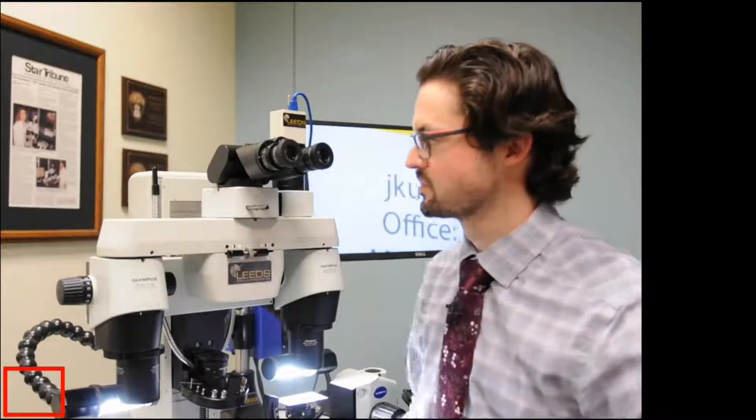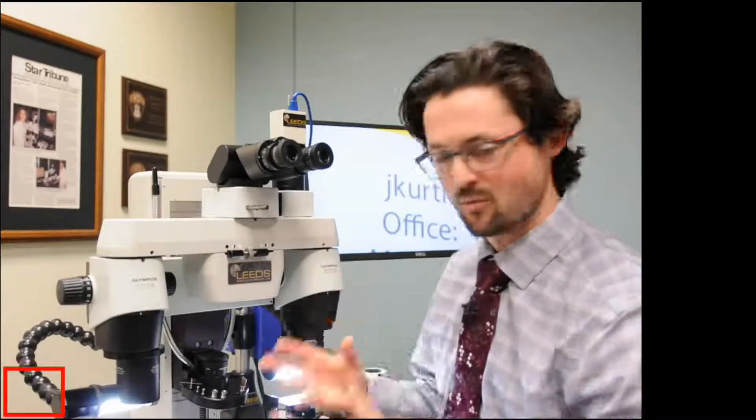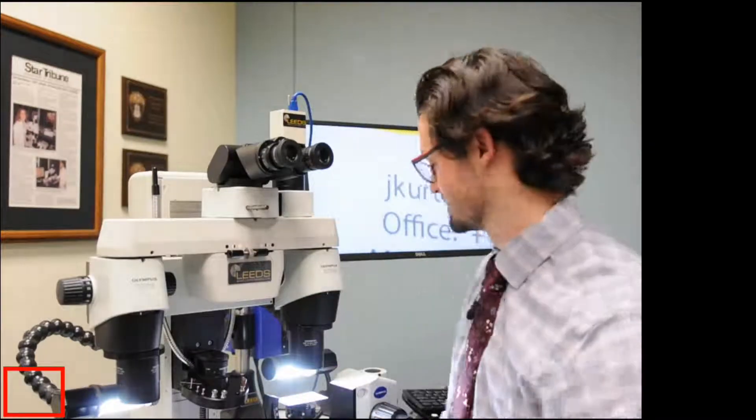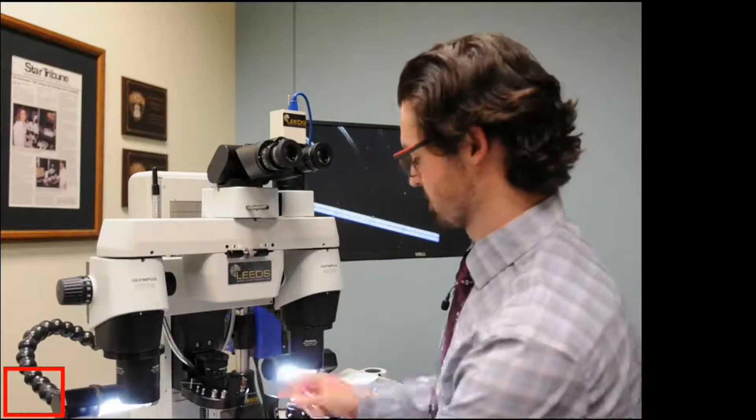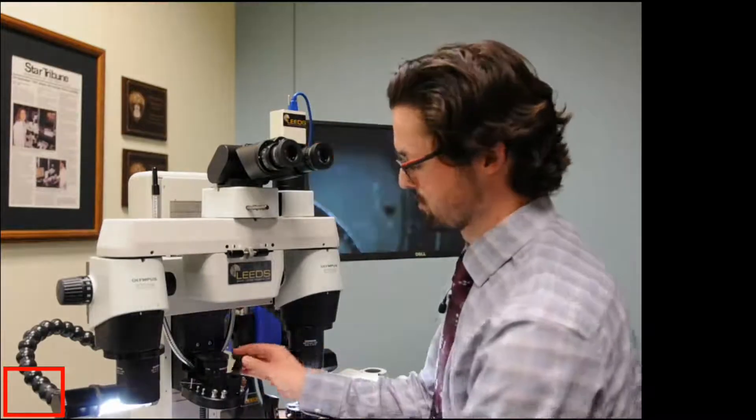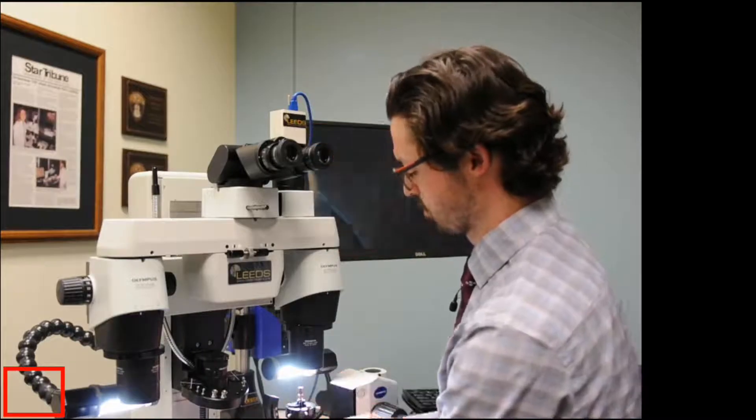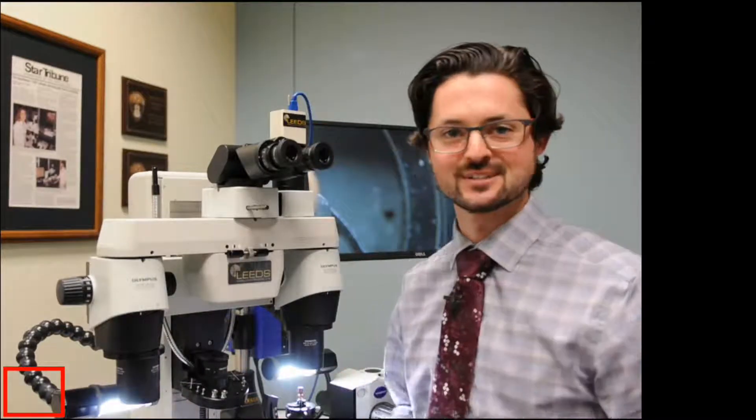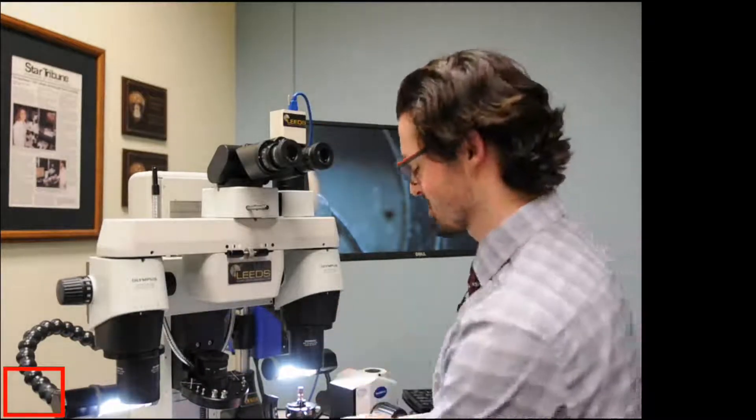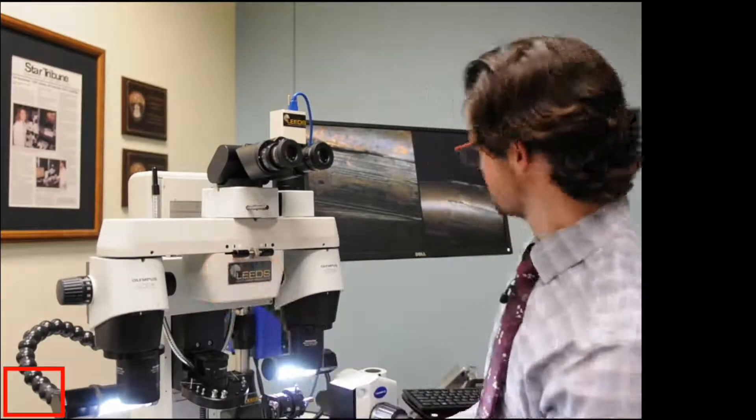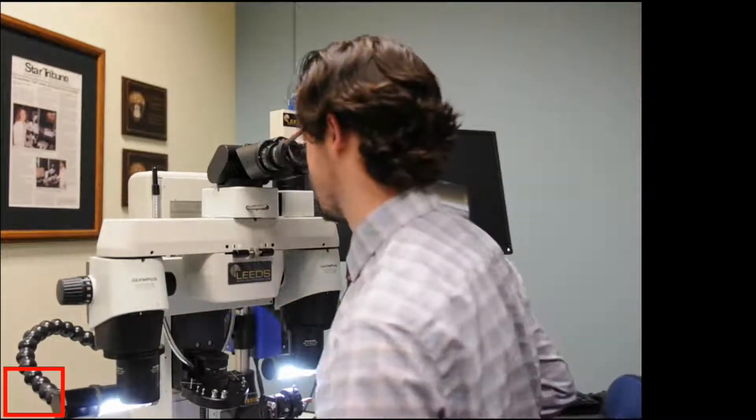Hopefully this is helpful as you guys are using things. I'm going to just load up my sample really quick and just kind of show you another cool thing. It's more of just when everything's working, when everything's cooking, it's right on your microscope. It's just really nice because you can very easily maneuver things around.